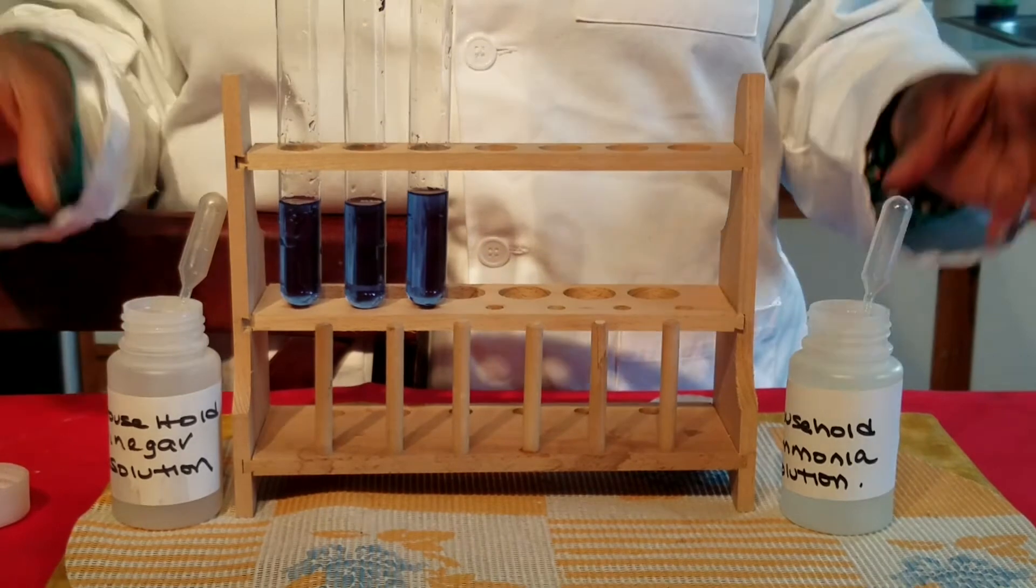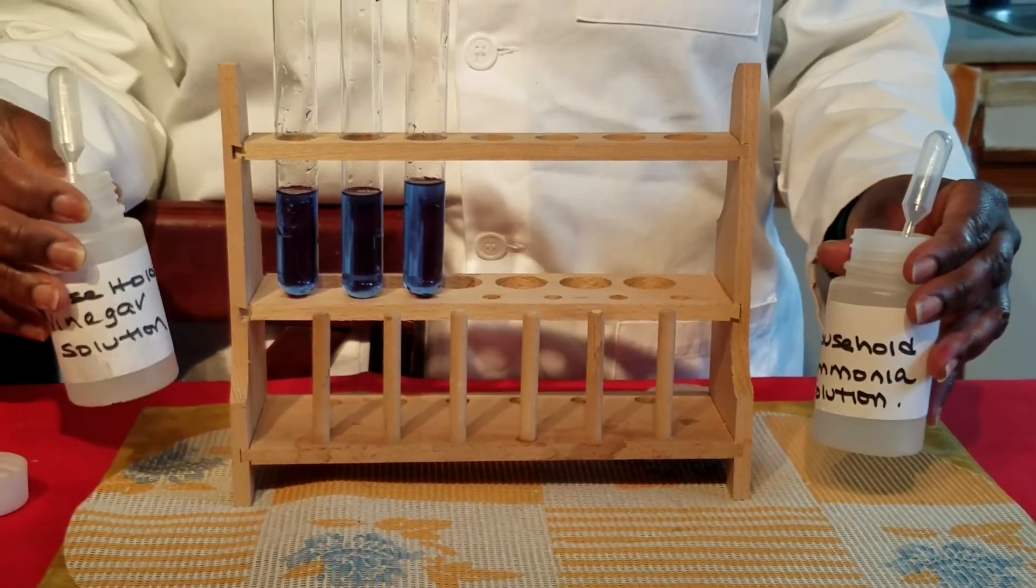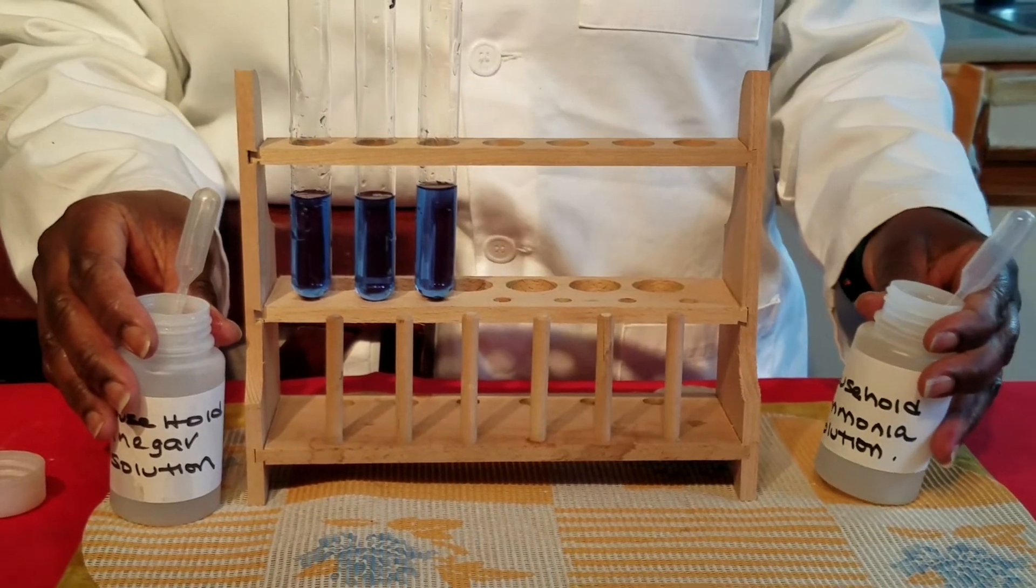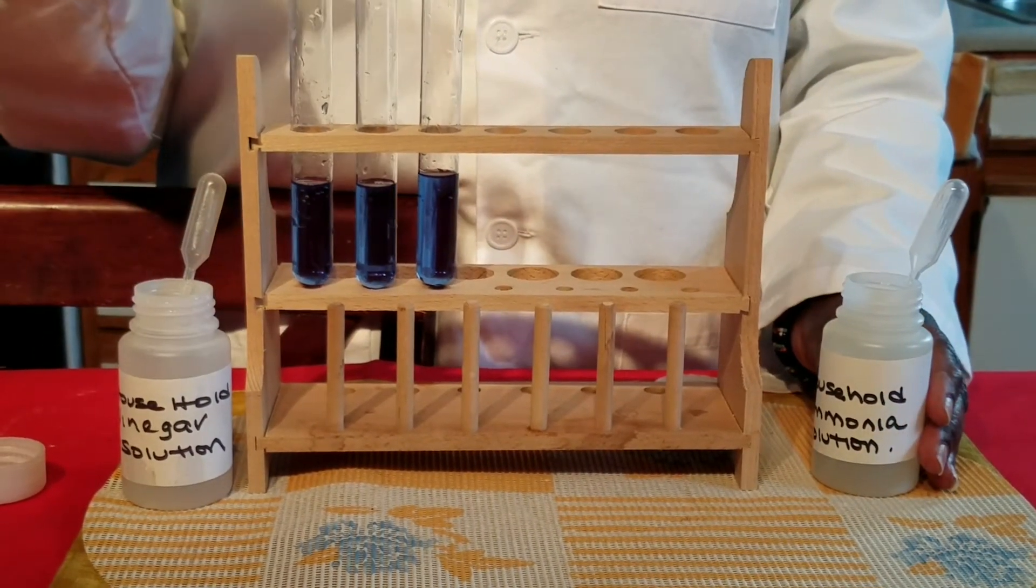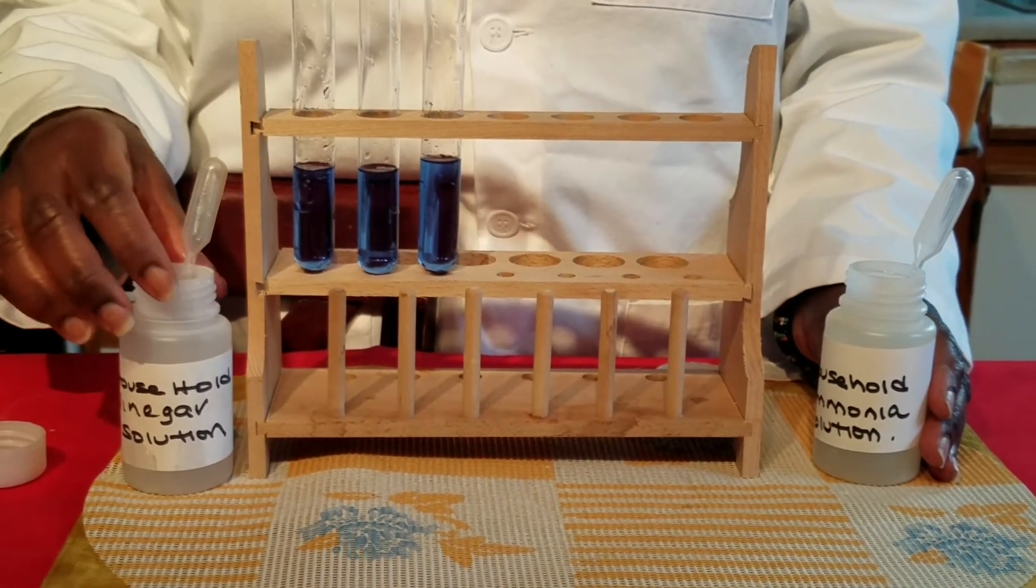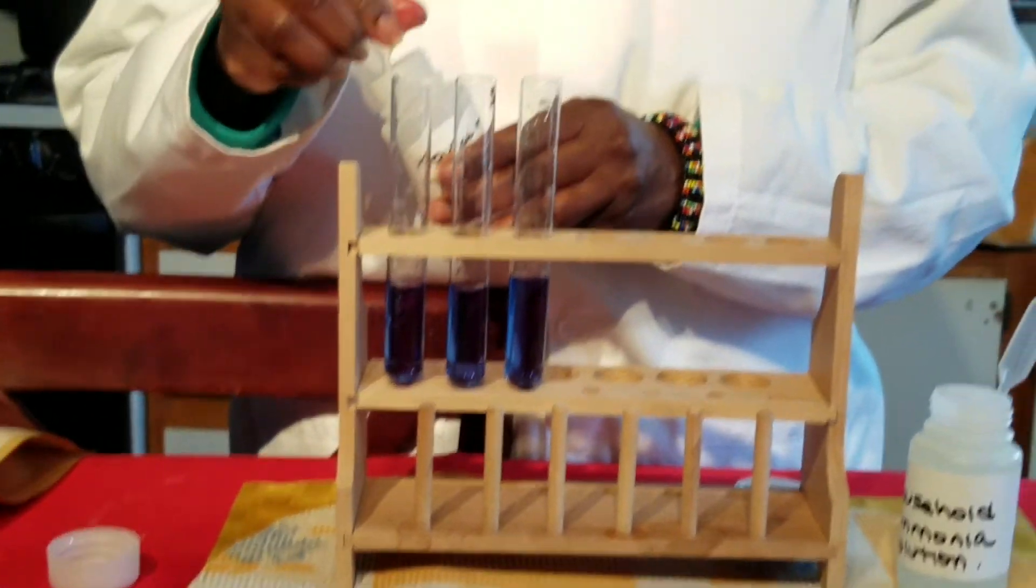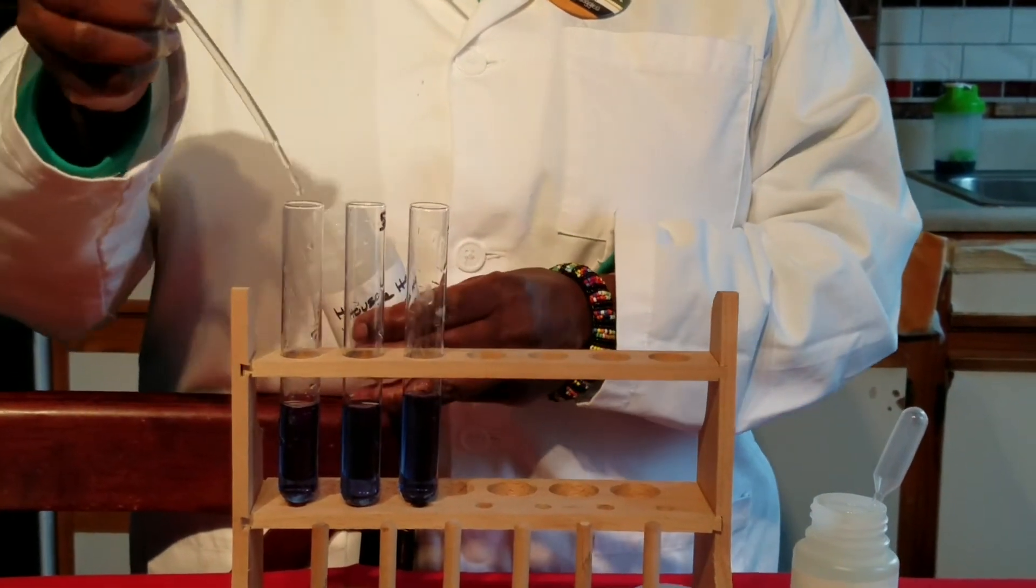And so if you think about your household, we have some common household acids and we have some common household bases. So to the test tube on your left, I am going to add some common household vinegar which is an acid. And I will add a squirtful.